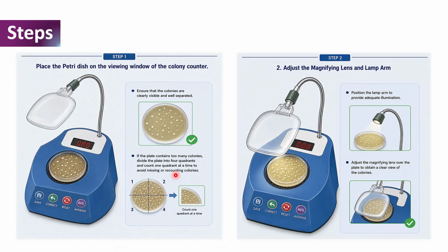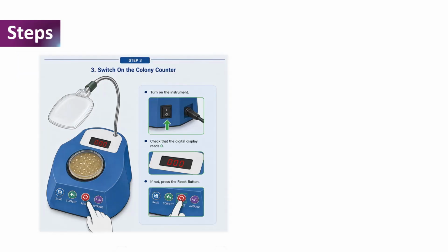And once this is done, we adjust the magnifying lens over the plate to obtain a clear view of the colonies as shown over here, and then position the lamp arm to provide adequate illumination. And once we are done with adjusting the magnifying lens and the lamp arm, the next thing to do is to switch on the colony counter.